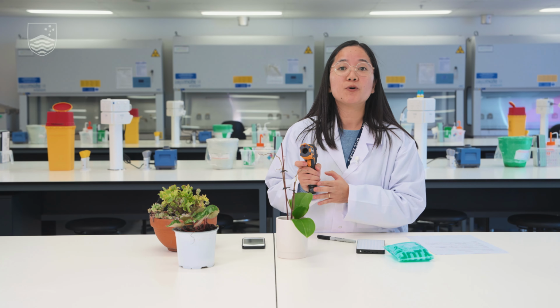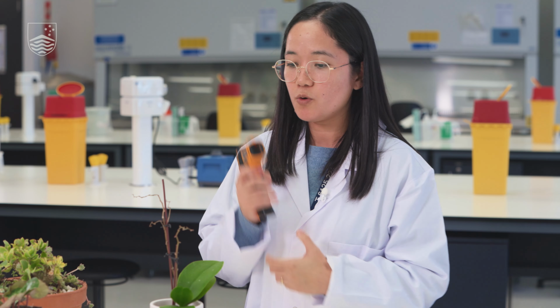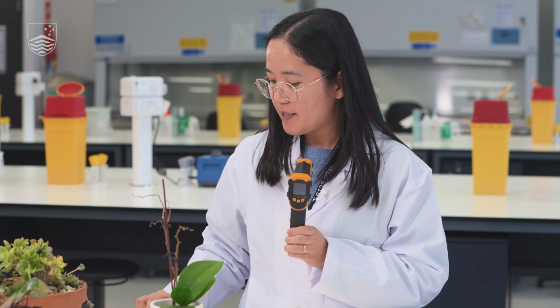So we're actually going downhill here. The time it takes to recover to that baseline is what differs for each of the plants. Okay, so we'll test again. Yep, and now it's at 21.8. So that means we have achieved our baseline after 7 minutes.